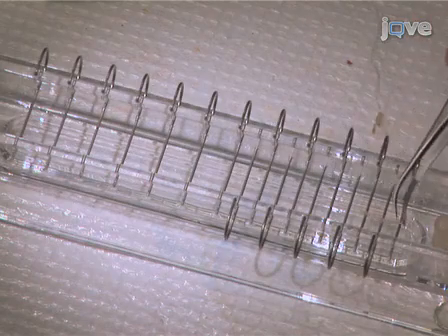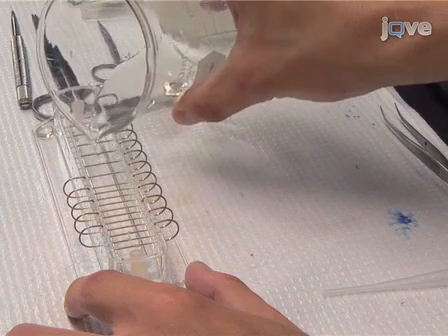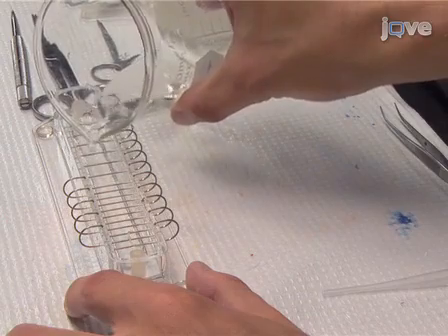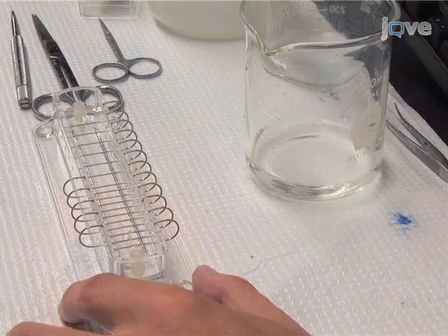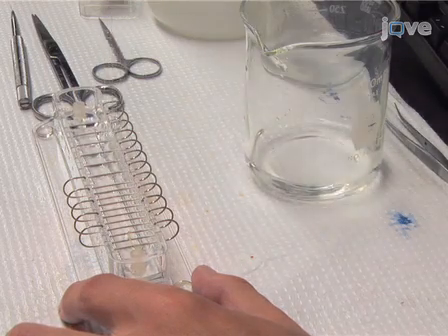It is imperative to keep the ventral nerve cord moist. To accomplish this, add enough crayfish saline solution to the nerve chamber to reach the level even with the metal crossbars. Next, pipette out enough of the crayfish saline solution so that the level of the liquid just makes contact with the bottom of the bars.